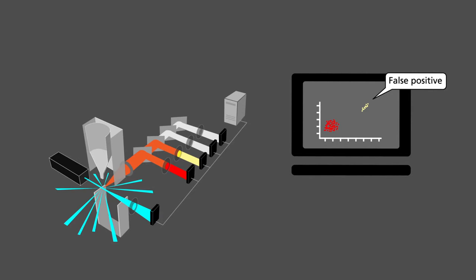When reading fluorescent emissions, we should be aware that some of the light from one fluorochrome will be read in the channel of another fluorochrome, thus giving us the false impression that some of the latter fluorochrome is present. Therefore, we must compensate the reading on the cytometer. We do that by telling the machine the percentage of light from one fluorochrome that is read as another fluorochrome.